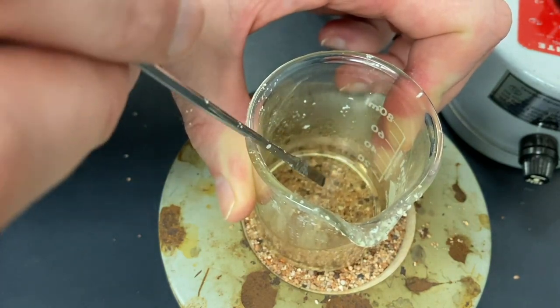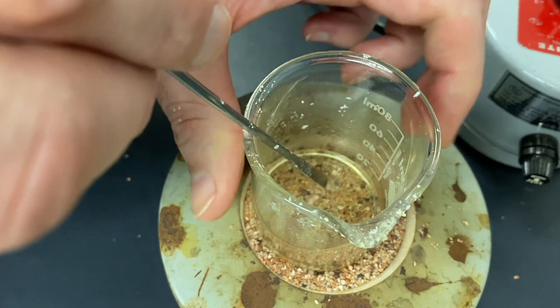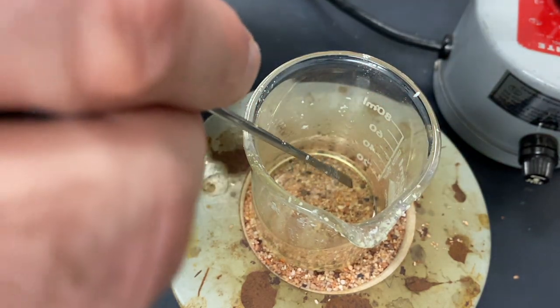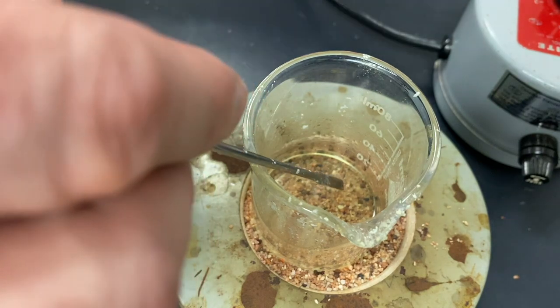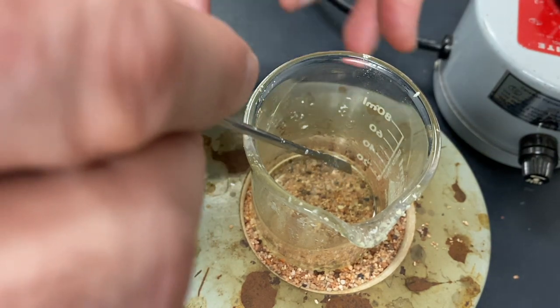And it's getting close to the boiling point. What we want to do is get all of the solid dissolved. And then let it cool down. And hopefully a pure crystal of our product, para-nitrobromobenzene, will come out of the solution.